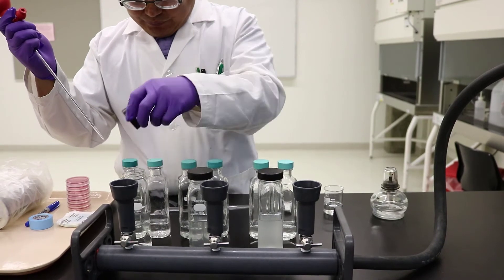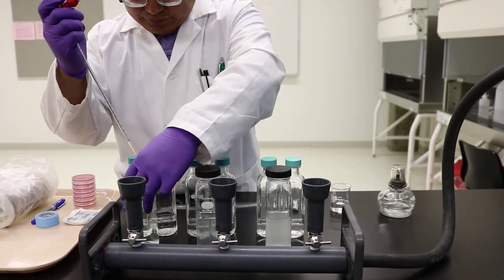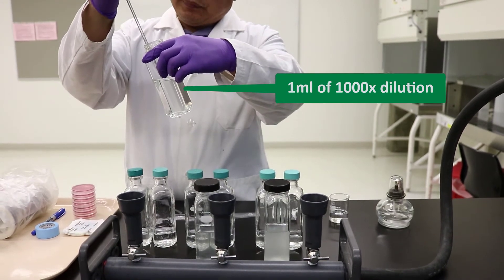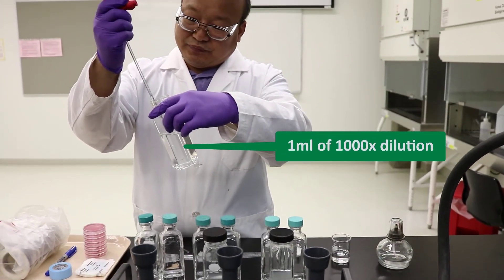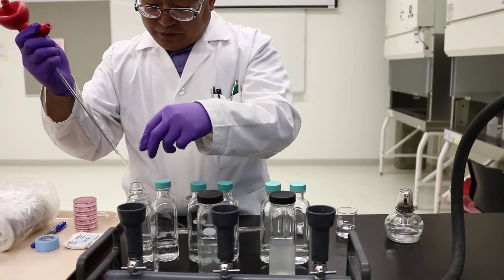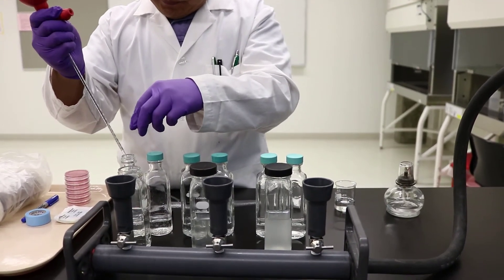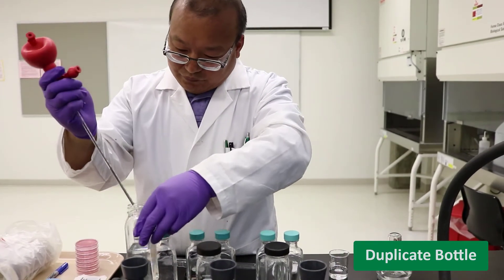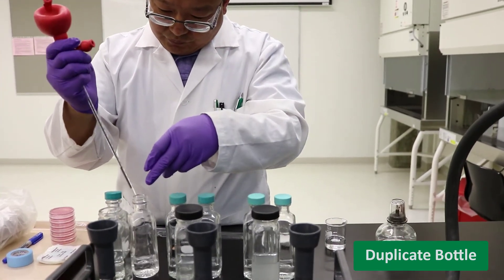When starting the filtration, we always start with the most diluted sample. Take 1 ml from the 1000x dilution sample bottle and transfer it to a bottle with 30 ml of dilution solution. Repeat this, as you will need to prepare 2 bottles of each dilution sample in order to have duplicate data.